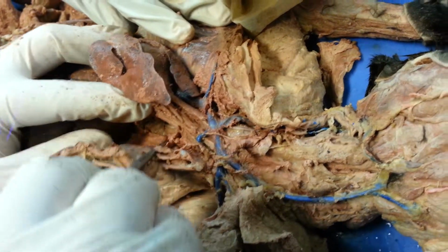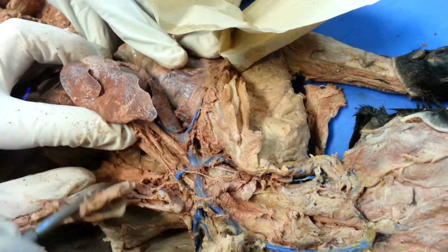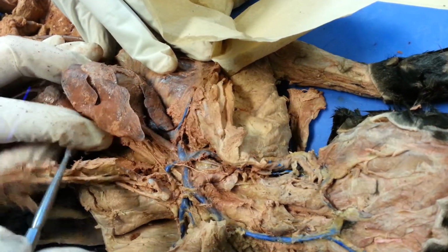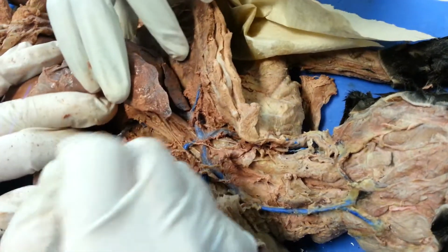Oh man, did I just tear that? No, I got muscle, not that. All right. Oh, no, you didn't. I see it.